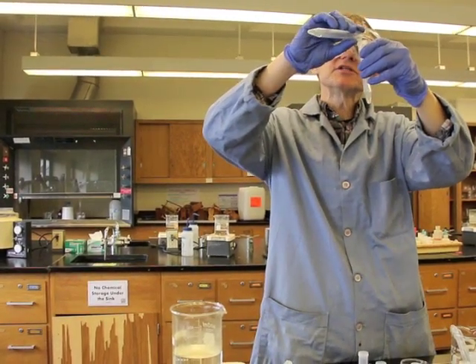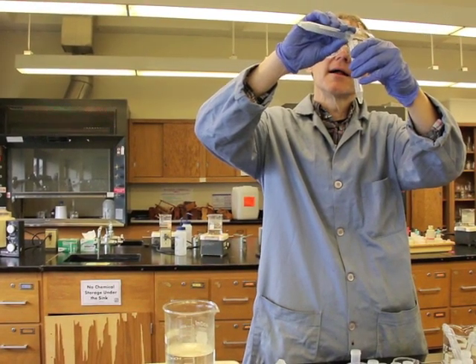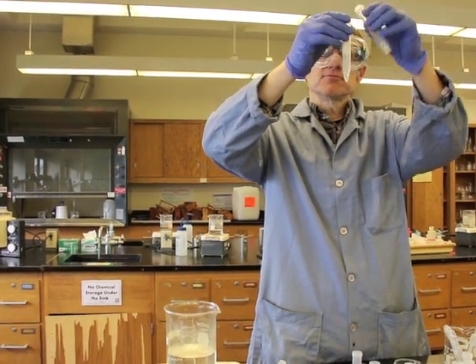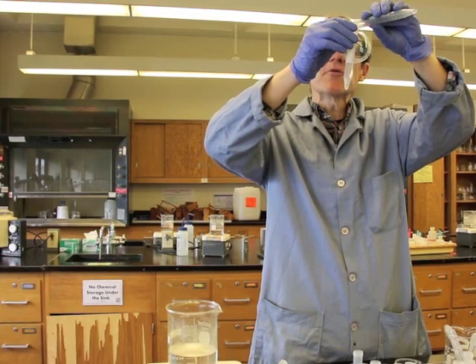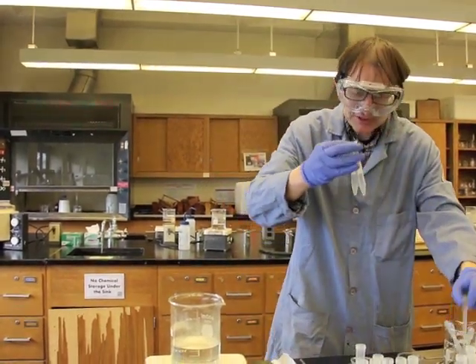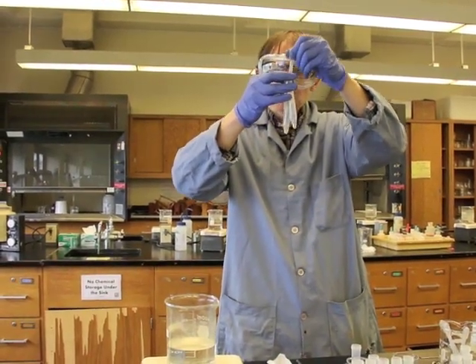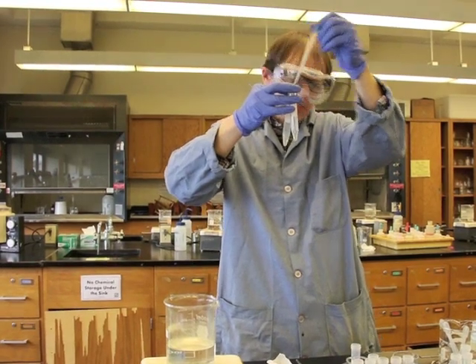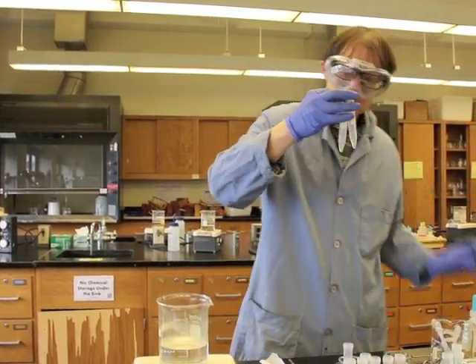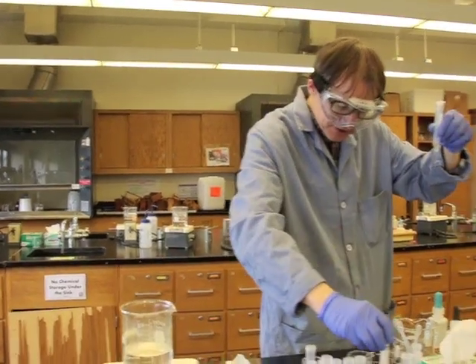Let's pour just a tiny bit back. It's an iterative process. Now, one way I could do this a little bit more quickly is to just go ahead and take one of these transfer pipettes. When you're transferring small volumes in these plastic tubes, sometimes it's difficult to get it to go. So this is just half of the supernatant.